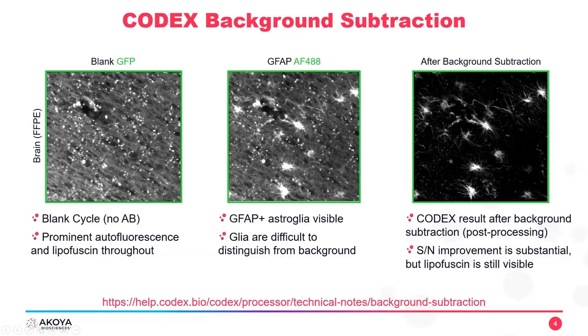Now, if we also go on to the next cycle in our CODEX experiment, here you can see now the GFAP antibody. When arrows are popping up here, these little yellow arrows are showing you glial cells. Glial cells are what we want to see. They label with GFAP at AF488. That is our reporter dye. This is your result. However, you still have a lot of different specks, little pieces of autofluorescence all over this tissue. You can see two examples with the red arrows.